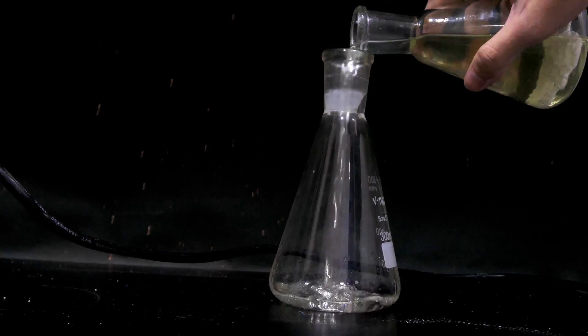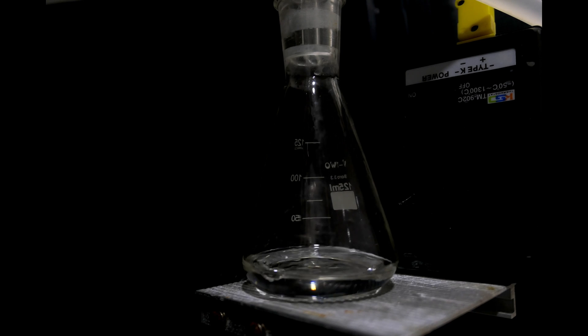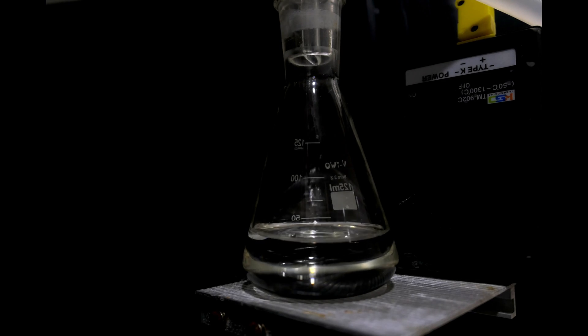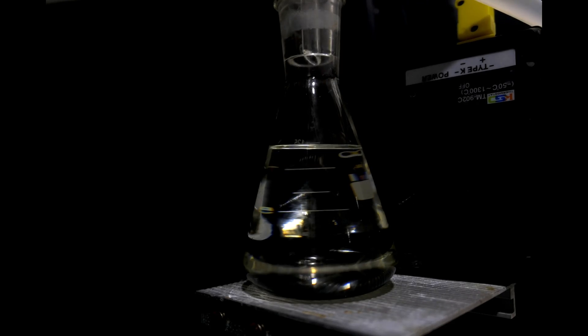After that, the calcium chloride is filtered out, and fractionally distilled. Fraction between 125°C to 130°C is collected. 103g of mesityl oxide is produced, and total yield is 67%. The low yield is because I accidentally spilled some product onto the table.